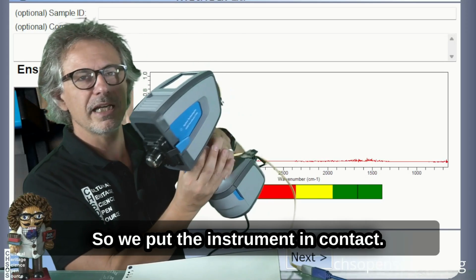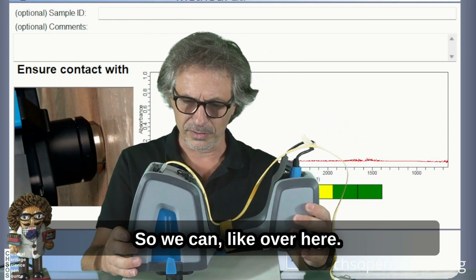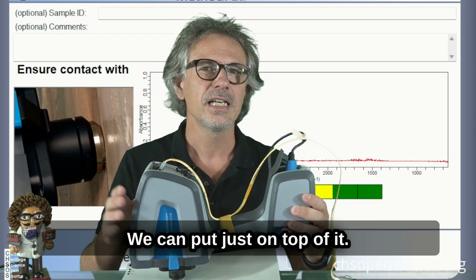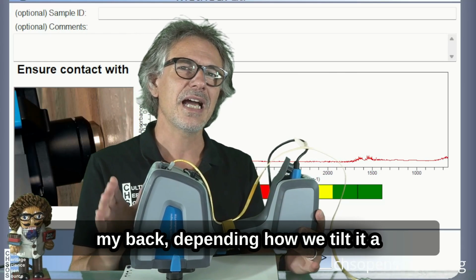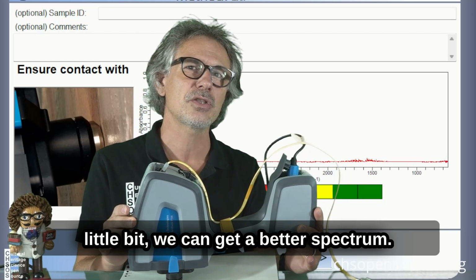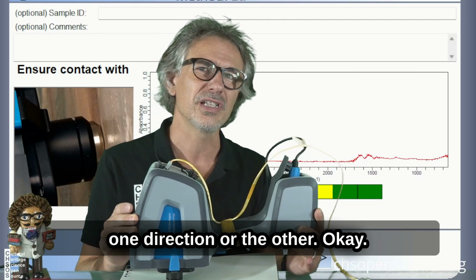We put the instrument in contact, we can hold it like over here, just on top of it, and on the spectrum you see on my back, depending on how we tilt it a little bit, we can get a better spectrum. You see, I'm just tilting in one direction or the other.